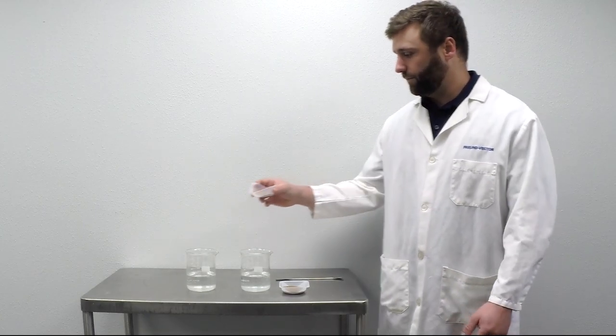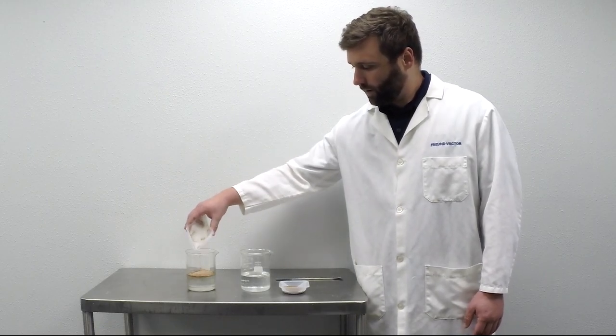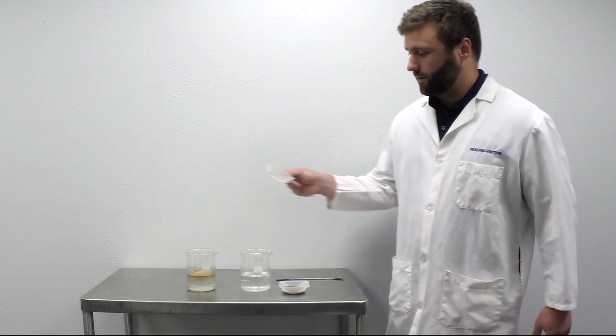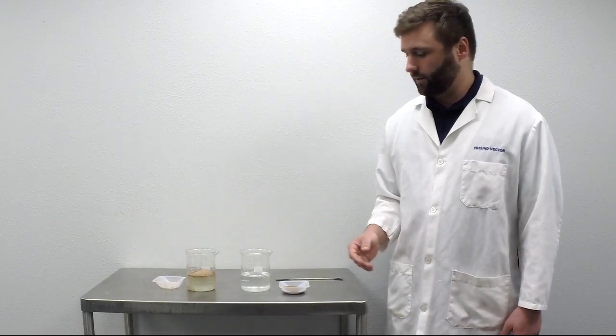So when we pour the first ungranulated product into solution, you can see it's starting to fall in a little bit but not nearly as fast as you'd like when you think of an instant dissolving product.